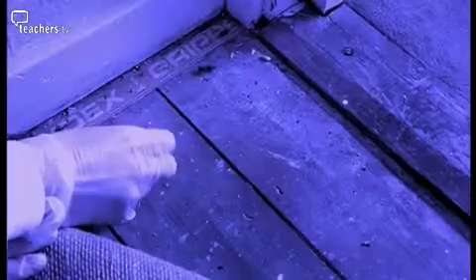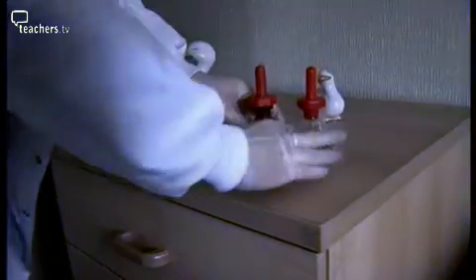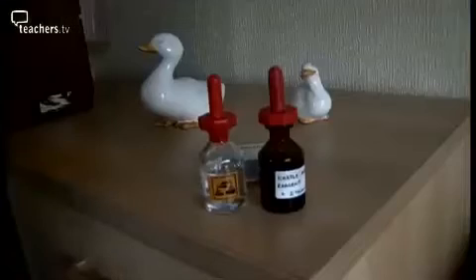I went to examine the main bedroom for any blood staining. Underneath the carpet there was a large area of blood staining, about 1/2 metre by 1 metre in size. We would still use the screening techniques because it's further confirmation that yes, that red-brown staining is blood. The chemical screening test that we use for blood is called Kastle-Meyer. In forensic science, Kastle-Meyer is used on a daily basis, both in the lab and at the crime scene.